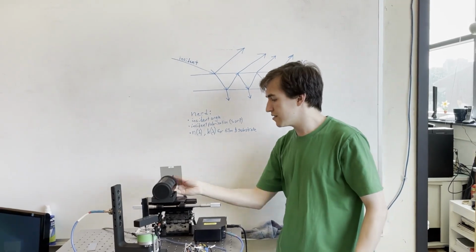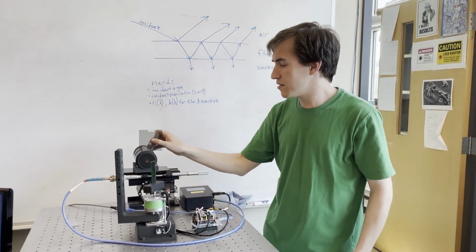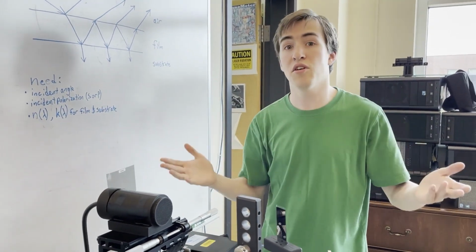The first thing is this optical fiber, which is our light source. Next is a polarizing film. This is necessary because it actually doesn't matter which polarization we use, we just have to know which one it is.